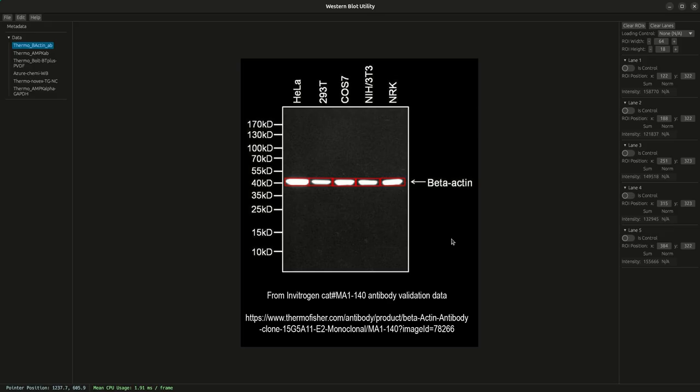But let's say you're happy with the positions of the ROIs, you're happy with the ROI and lane count, but you need to change the boundaries, right? Like I can clearly see here that the first ROI is probably a little too tight, and I don't like that. So what I'm going to do is I'm going to adjust the height of those ROIs. Currently, to adjust the height and width of an ROI, it's a global operation. So it applies to all of them. And this is because the calculations are easier to do and more robust if all regions are the same size in the same image. So in this case, I adjusted the height and I can clearly see all the ROI heights being adjusted as well.